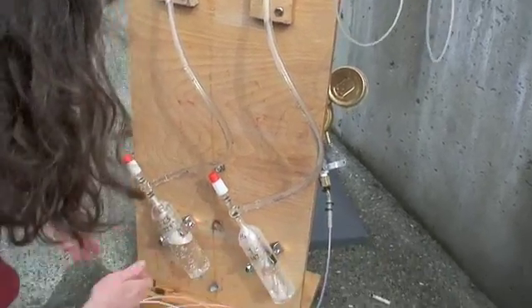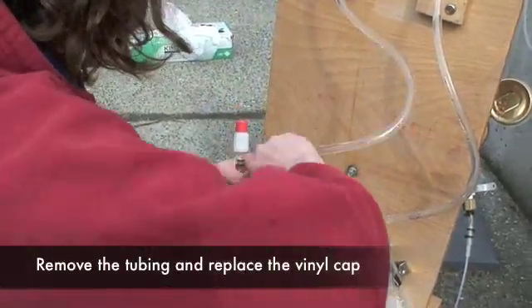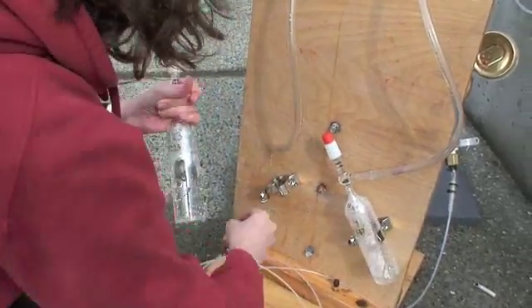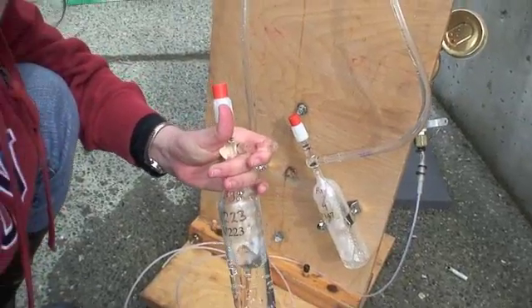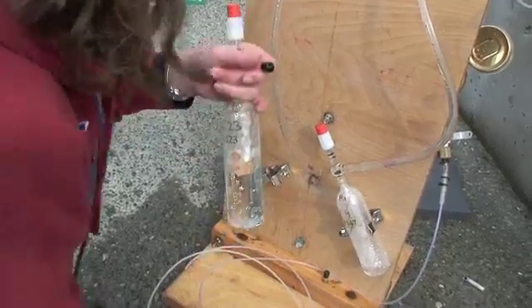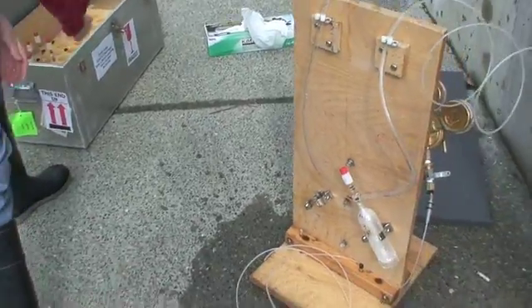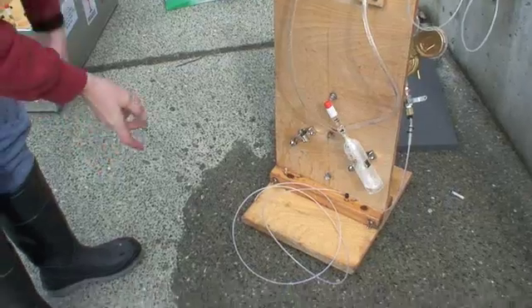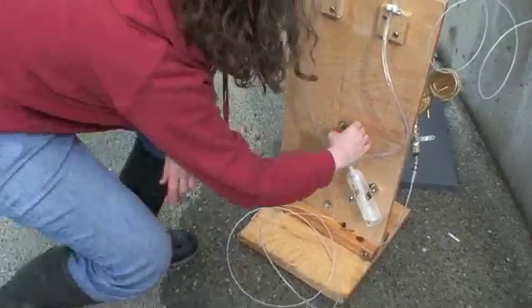And while this one is filling, now this other one I can take the tube off. I'll leave the neck full of water for now, we're going to clean that out after we're done here, and this can go back in the box. If you're going on to sample more, you just get your next bottle out and start the CO2 flush.